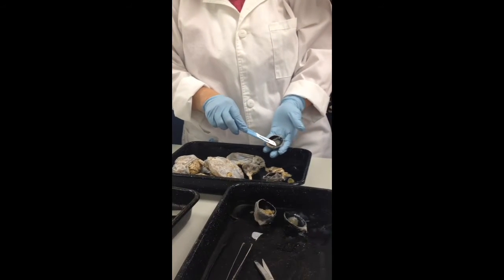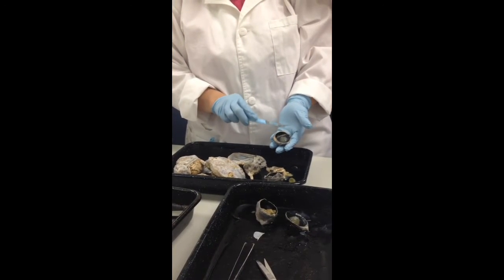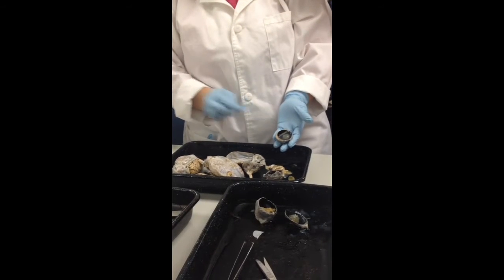Now as we go inside the eye, you encounter this gelatinous type of fluid. What is this? Jelly-like stuff. Vitreous humor. Okay, and the vitreous humor is filling the posterior segment. So remember, the posterior segment is from the lens back.